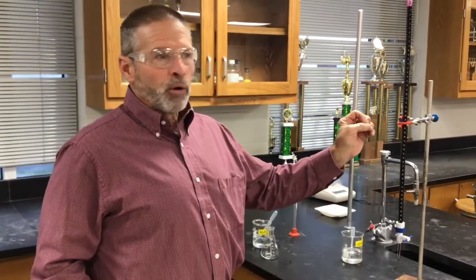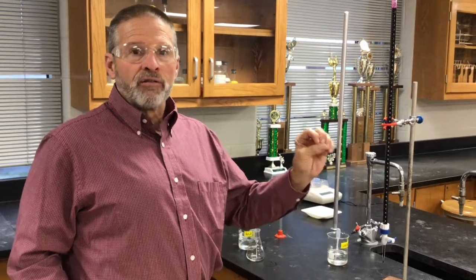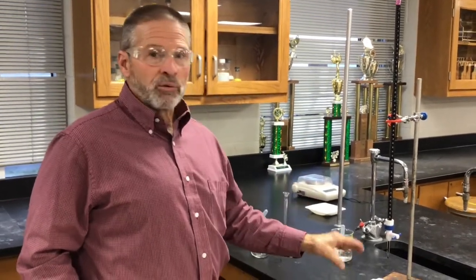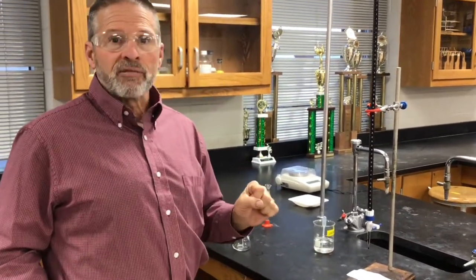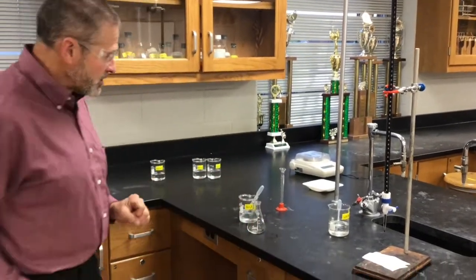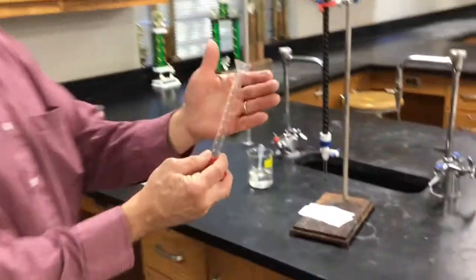It's this deep purple color now, but at the end of the reaction, it'll convert to Mn+2, which is colorless. And so as we're titrating, you'll see the purple disappear because there's an excess of peroxide. But when we hit that end point, it's going to be a nice light purple color, and it'll tell us when to stop titrating.